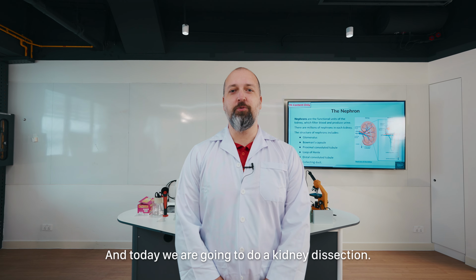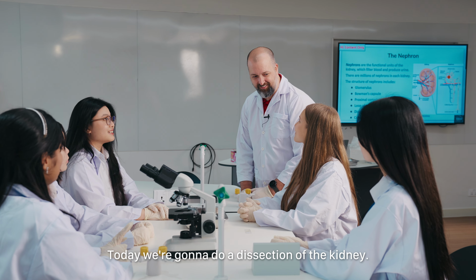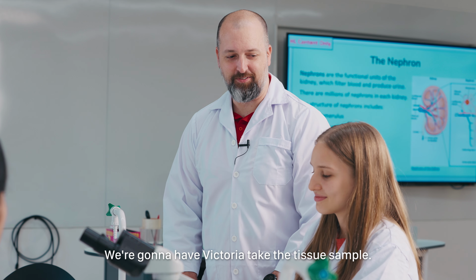And today we are going to do a kidney dissection. Hi. Today we're going to do a dissection of the kidney. We're going to have Victoria take the tissue sample.